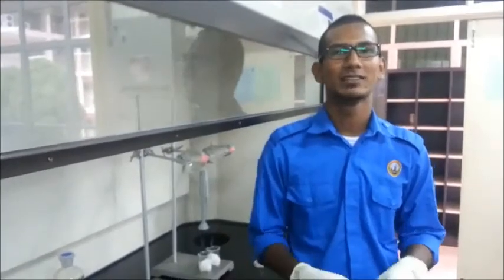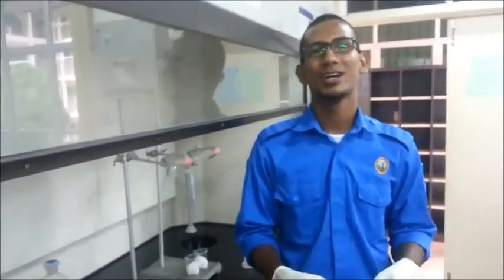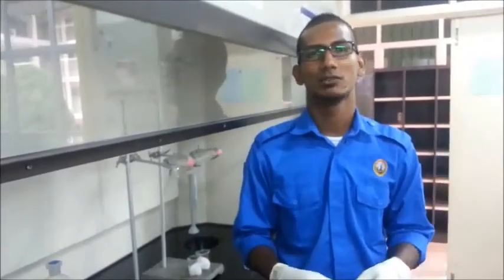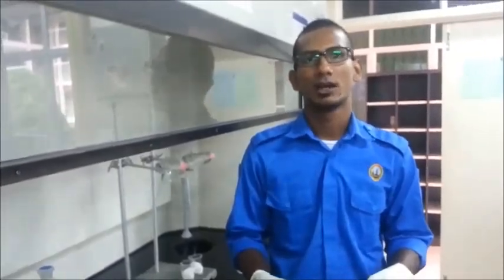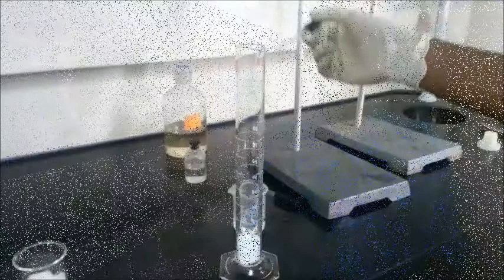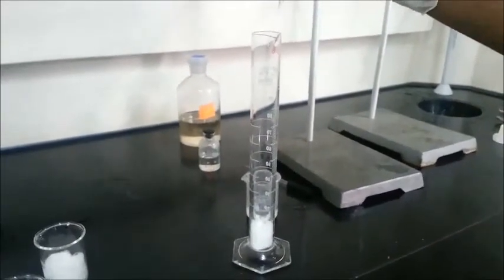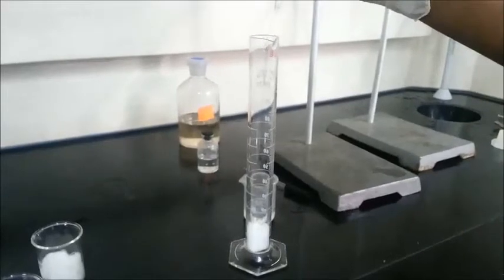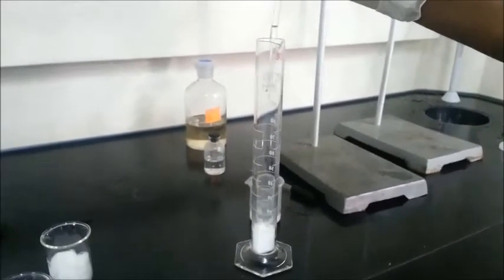Okay. Assalamualaikum and very good morning to Madam Azzyati who's watching this video. Today I will run an experiment about diffusion of gas, ammonia and hydrochloric acid. What we have in this experiment is an ammonia solution, NH3, and hydrochloric acid solution, HCl.